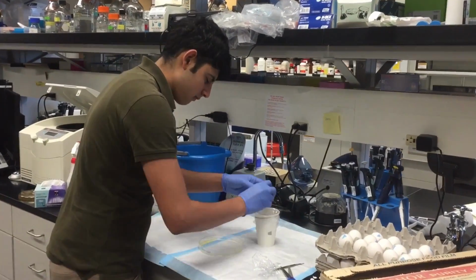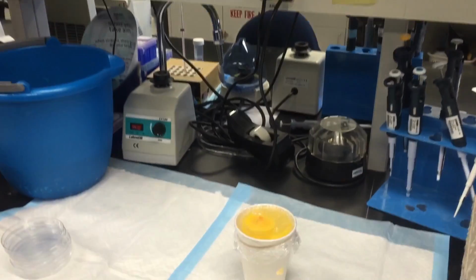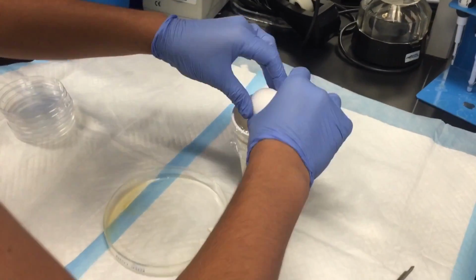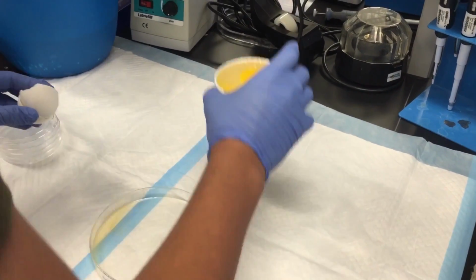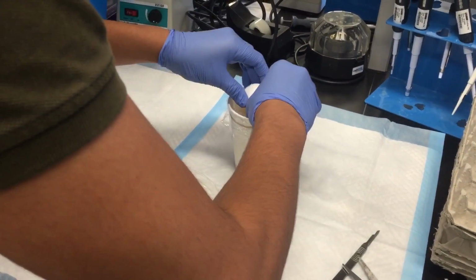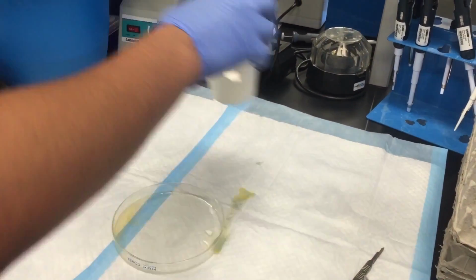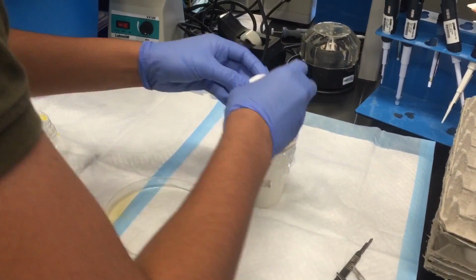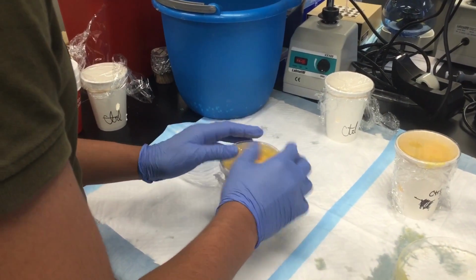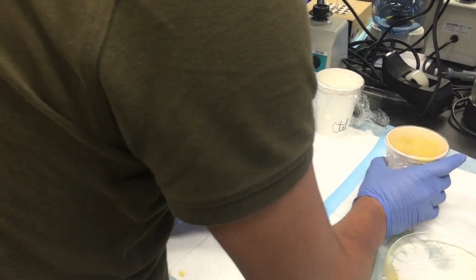After the cup is ready, we need to crack and suspend an egg at stage 17 into the saran wrap. Several of the egg yolks crack, or some of them are not fully developed. The yolk needs to be intact in order for the embryo to continue to develop. However, after numerous tries, we get our perfect embryo into the cup. The cup is capped with a piece of plastic and placed into the incubator for another 15 hours of development.